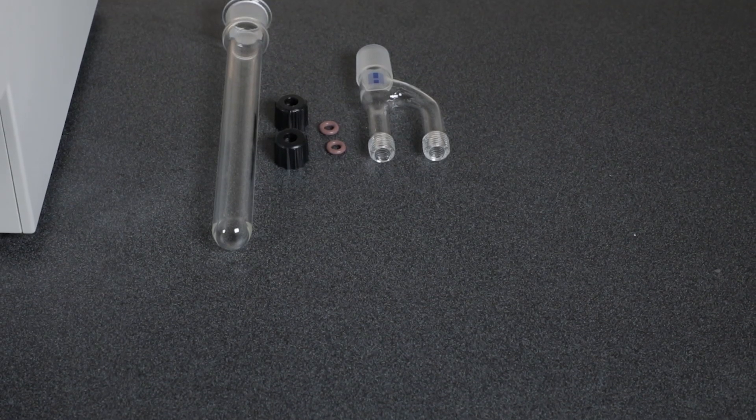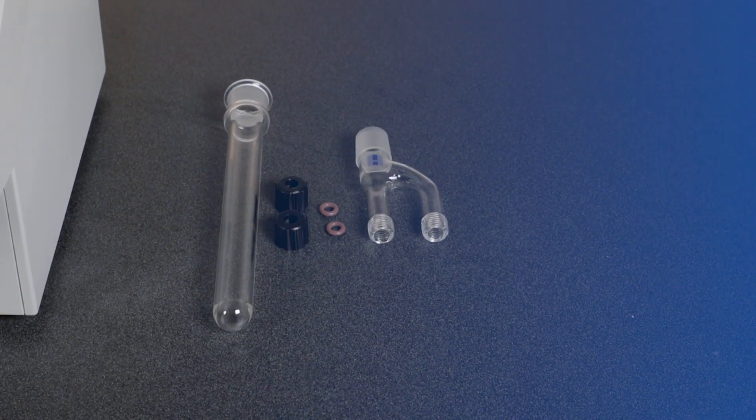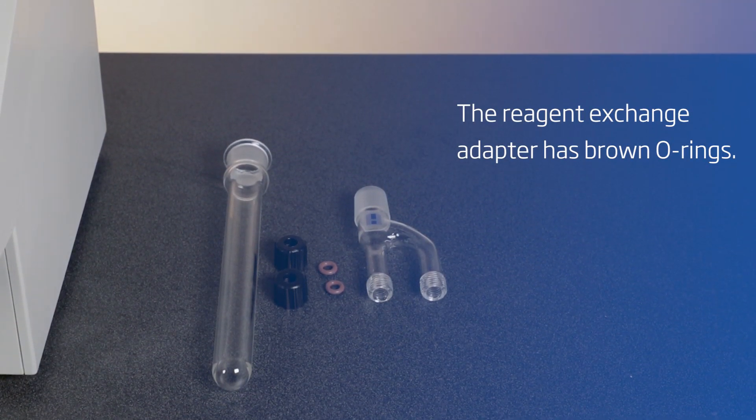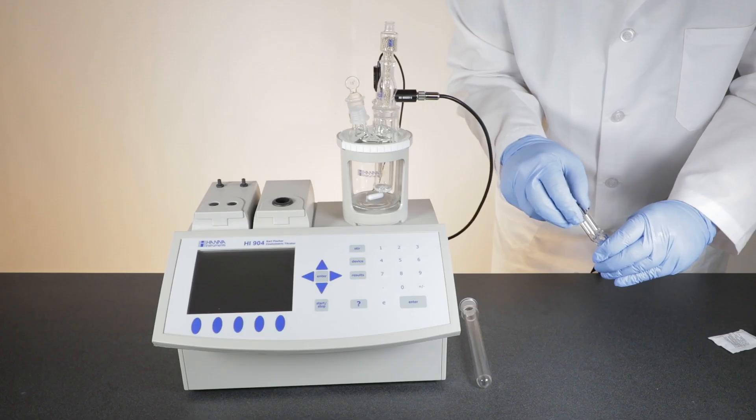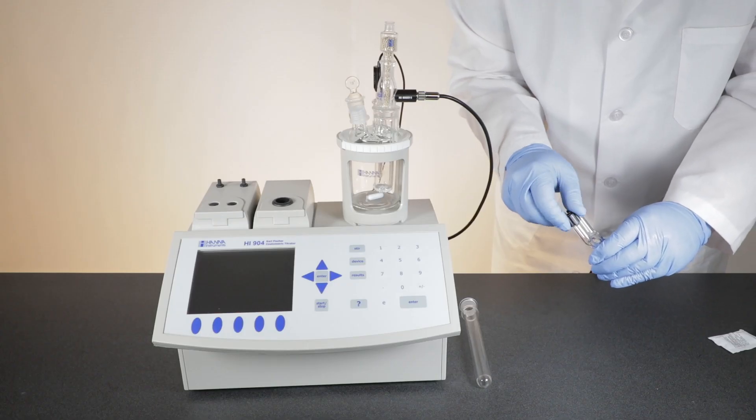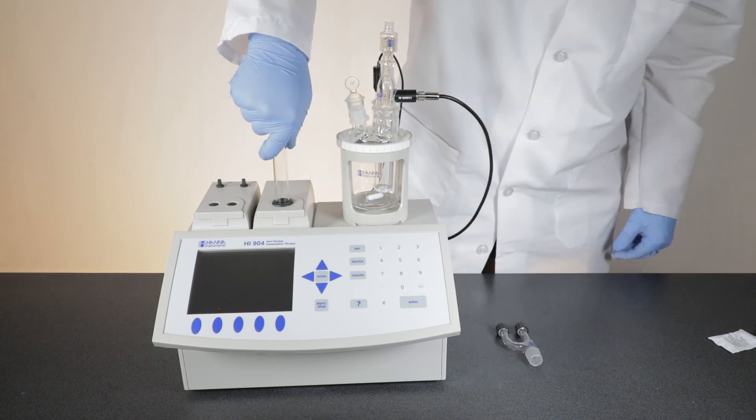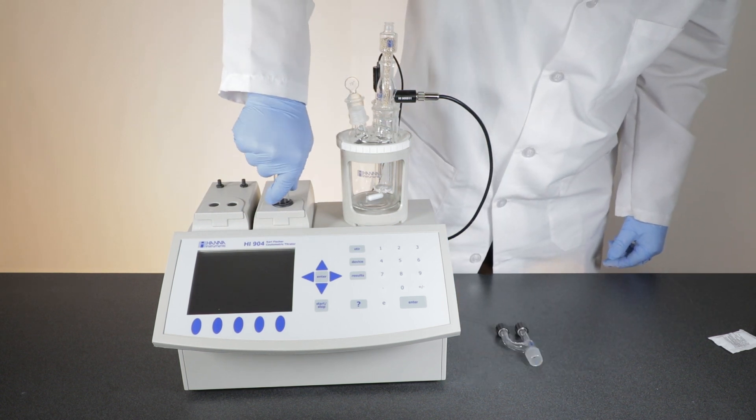Begin by verifying that the appropriate O-rings are present in the screw caps of the reagent exchange adapter. Now, take the reagent exchange adapter holder and push it down into the titrator body here.